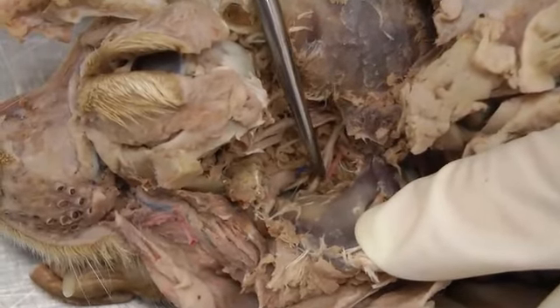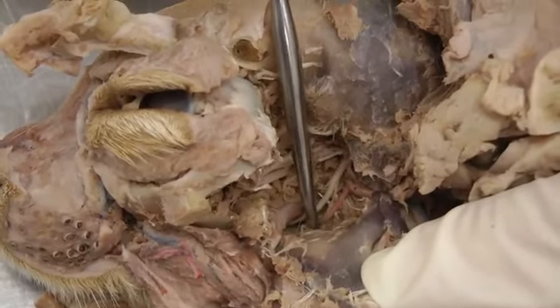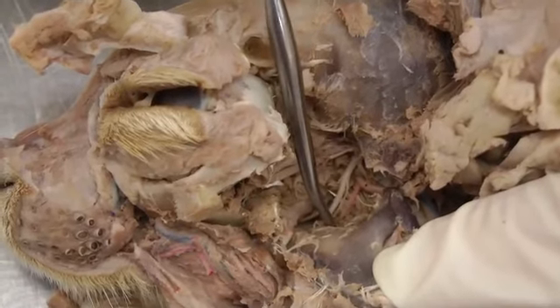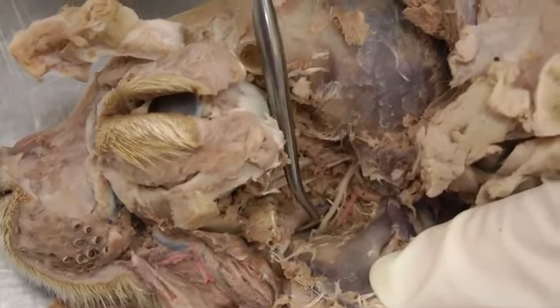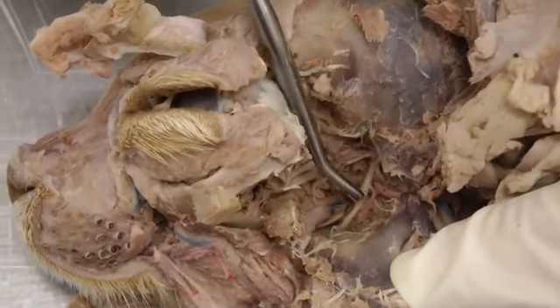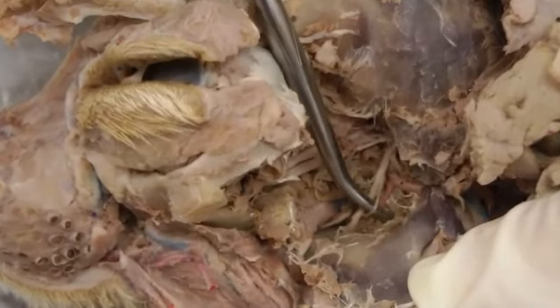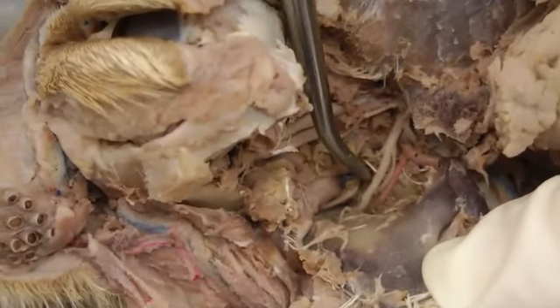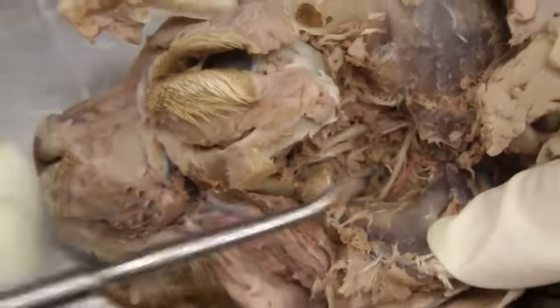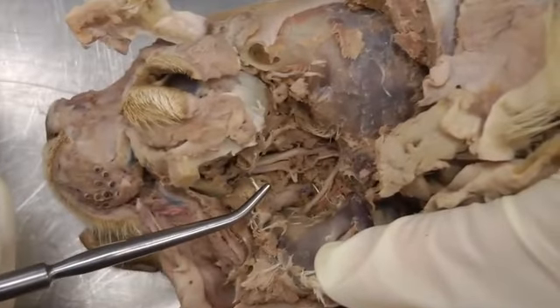And then we have the inferior alveolar nerve here, this nice big one, going into the mandibular foramen. Alongside it is that artery of the same name, so we'll get to that in a little bit. But inferior alveolar nerve, and then this little tiny guy right next to it is the mylohyoid nerve. You may not see that one very well in the cat. But mylohyoid, inferior alveolar, lingual nerve. And then buccal was this other broken piece up here. All of those are coming off of the mandibular nerve.